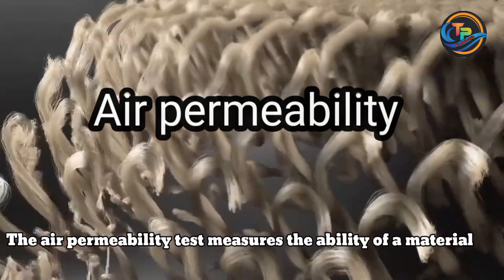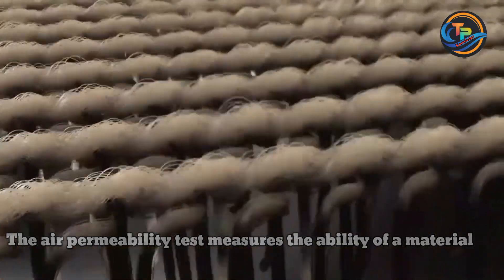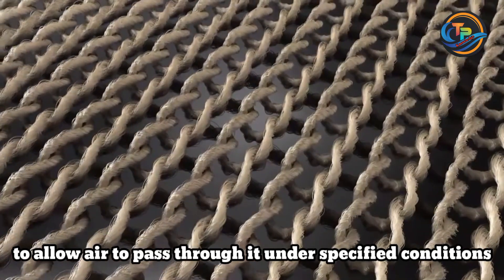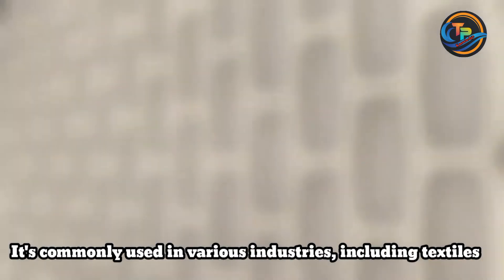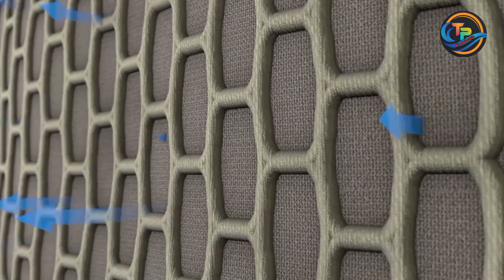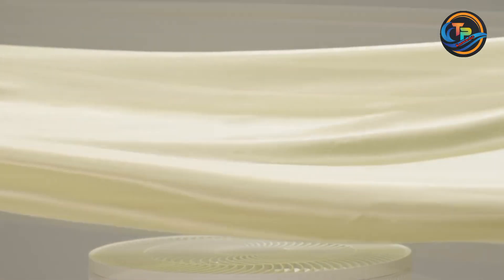The air permeability test measures the ability of a material to allow air to pass through it under specified conditions. It's commonly used in various industries, including textiles, construction, and manufacturing, to assess the breathability or air resistance of materials such as fabrics.